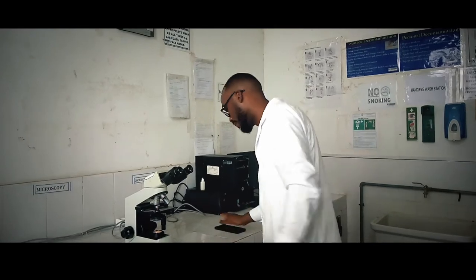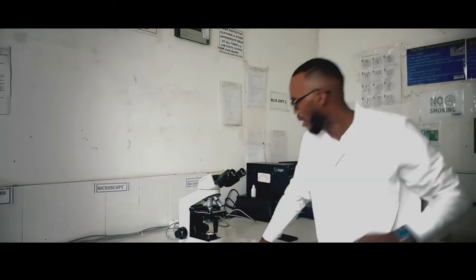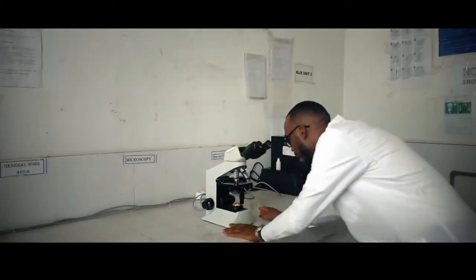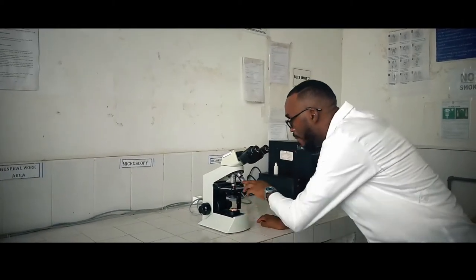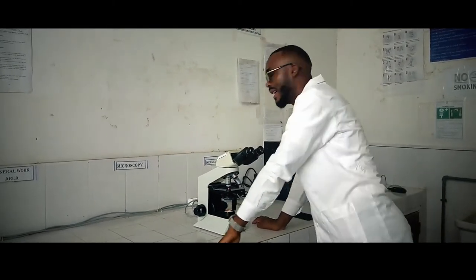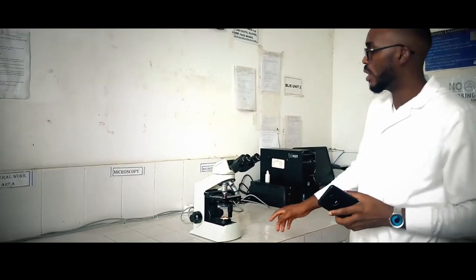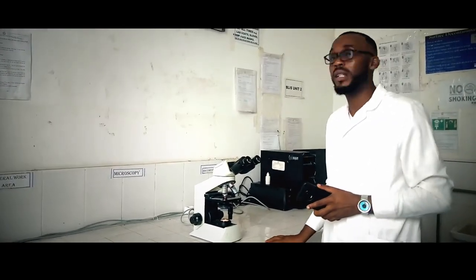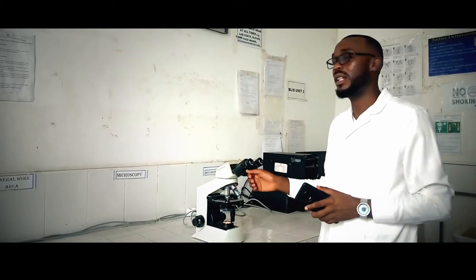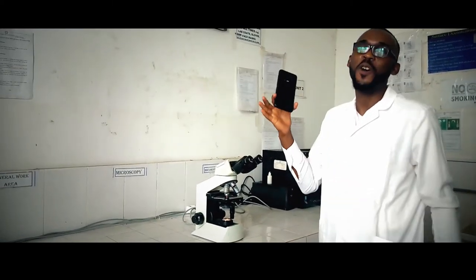From the first steps, we have the microscope. Of course, we have the microscope because we can take pictures from the microscope at all. This is the microscope. I've put it on. I've mounted a vaginal smear slide that has been Gram stained, and now we are about to view the contents of the slide. But this time around, we wouldn't be using our eyes on the ocular lenses — we will be using the eyes of the phone.